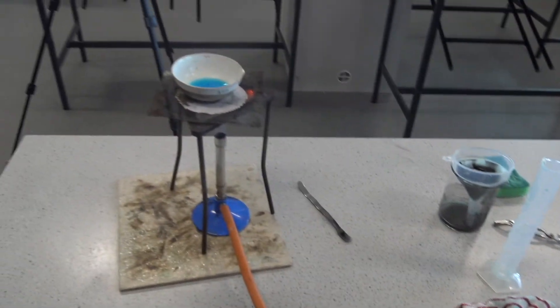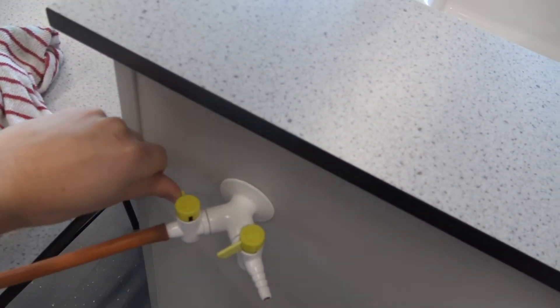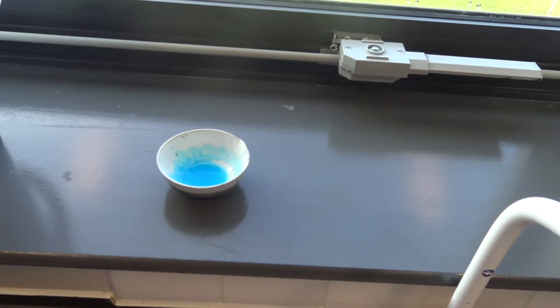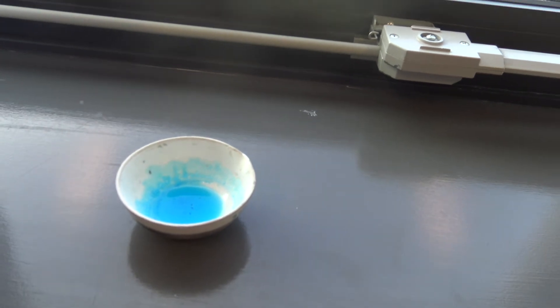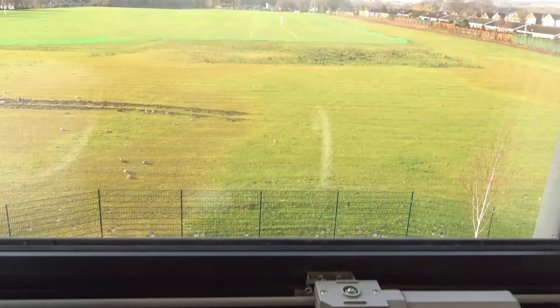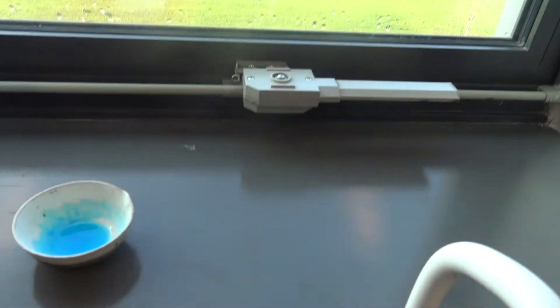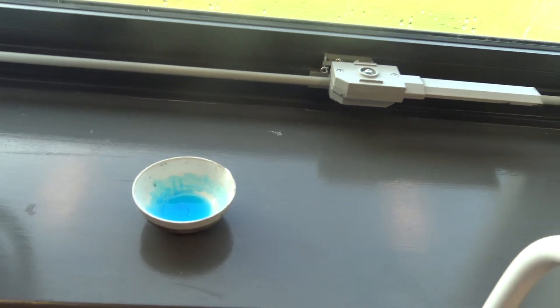Once you've finished heating, you should leave it on a windowsill. The longer you leave it, the bigger crystals you can get. Have a look outside, what a beautiful day. Hopefully we'll get some really nice crystals coming out of it. I feel a bit like Walter White when I make these blue crystals.